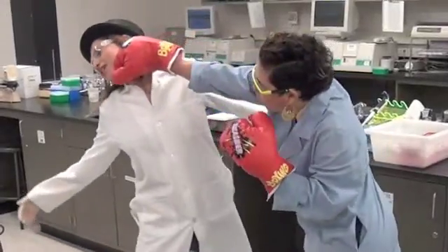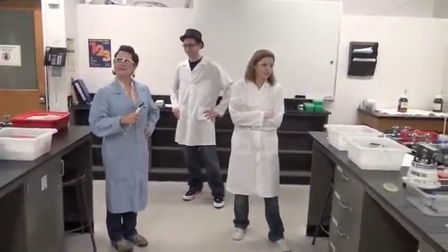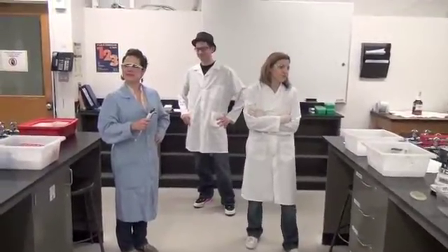Well, that does it for this round of Ionic Biochemist. Master TA is clearly pleased with Biochemist Dicer's performance. She saved all the purified samples and test aliquots and gave them to Master TA for safekeeping. She cleaned up all her equipment with soap and water and returned all non-disposable equipment without loss or damage. Although Master TA was disappointed with the challenger's lackluster performance, he can stand proud knowing that his Ionic Biochemist continues to reign supreme.